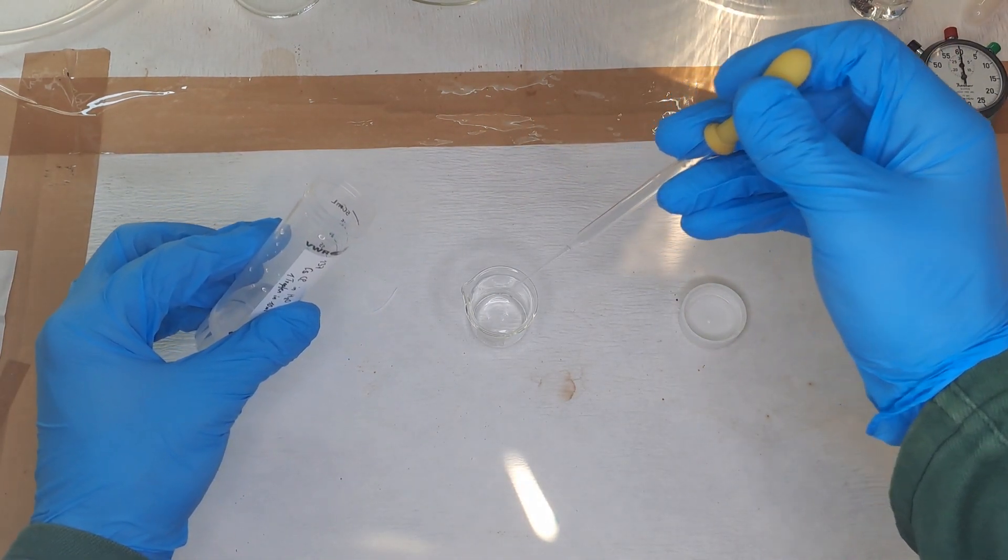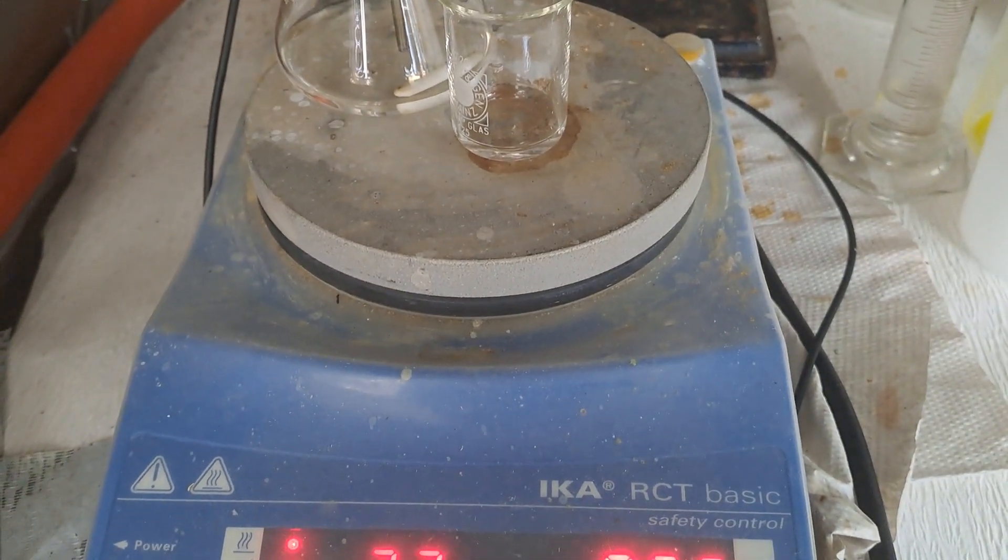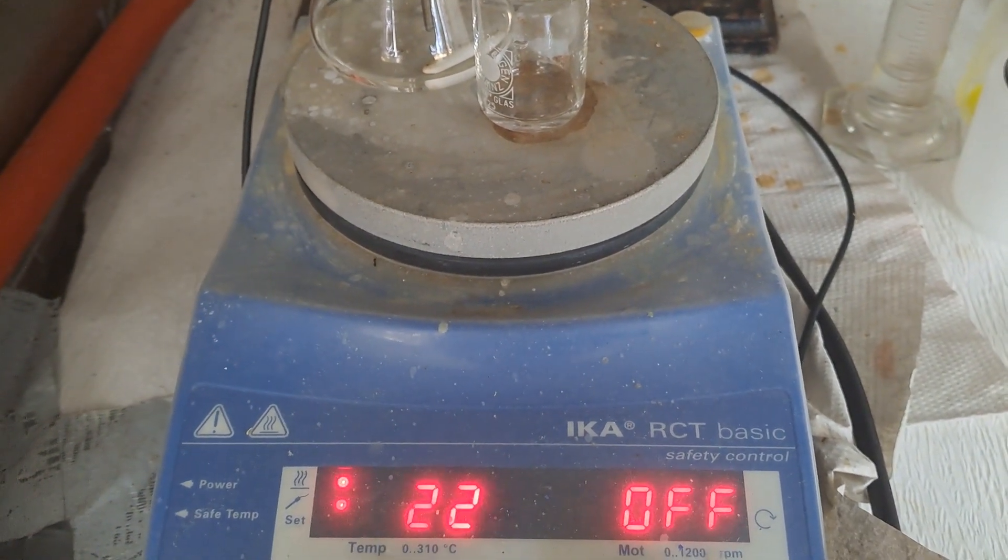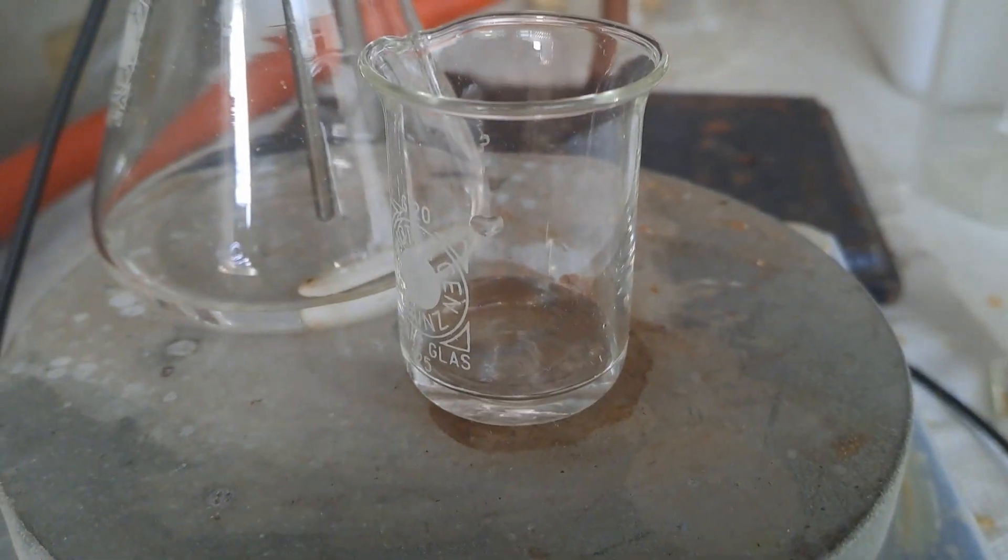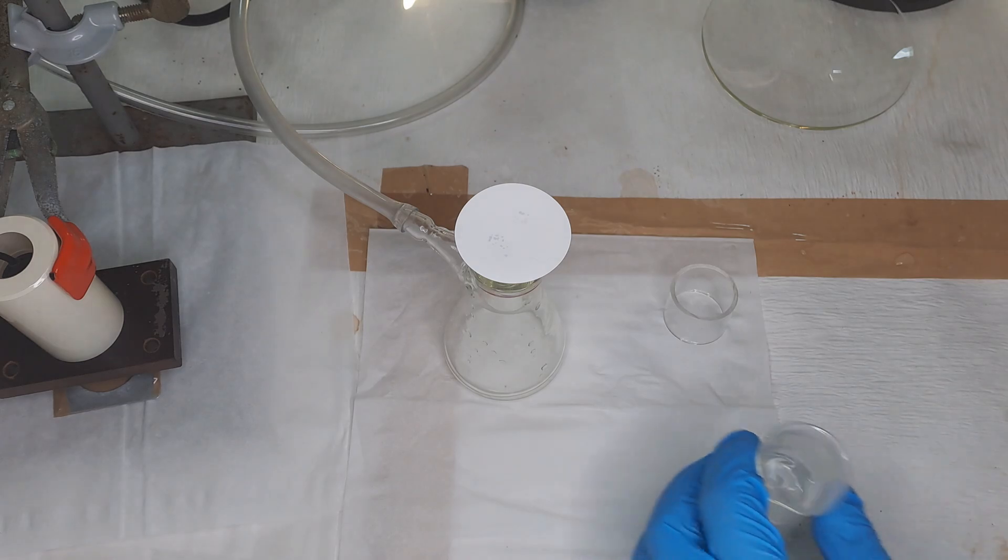Now the assistant would add a small amount of the radioactive cesium solution to the non-radioactive cesium chloride solution in the beaker. The exact amount here is not crucial. The solution with addition of barium chloride, which I didn't film, is heated on a hot plate for five minutes. The goal here is to simply warm it up.